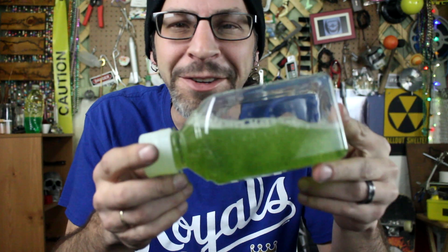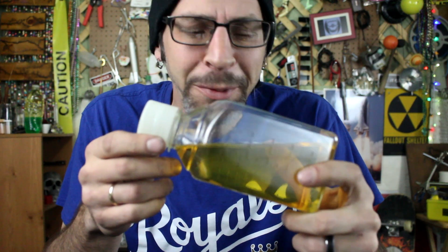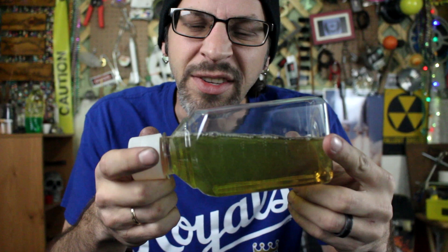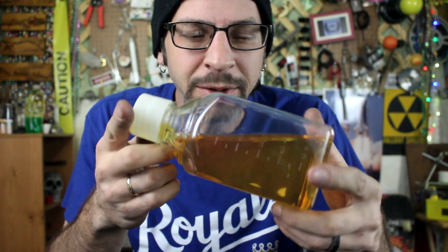It's a yellow solution that with just a brief shake can actually turn red, and more shaking will cause it to turn green. That's really amazing. It went back to yellow. I want it to be green — why won't it stay green? It keeps changing colors.